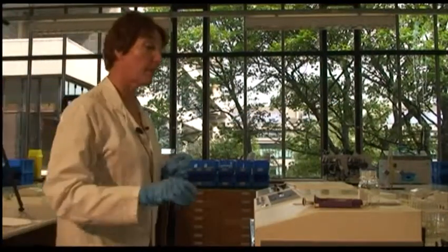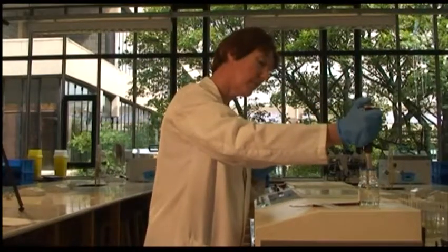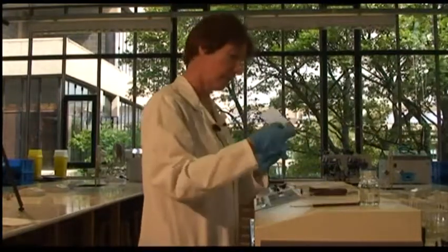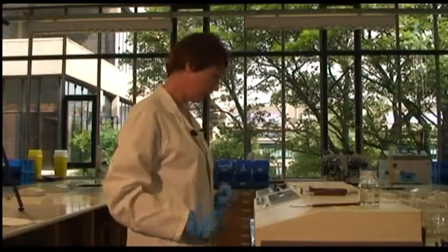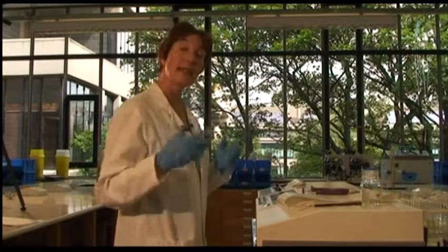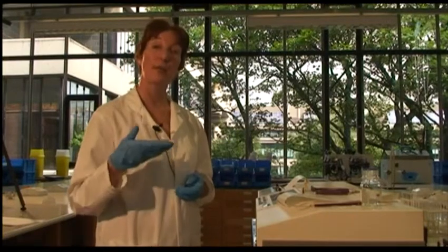If I repeat this experiment with less substrate, so here I've made up a cuvette which contains a much smaller amount of pyruvate, okay, I'll stop that now. If I'd let it run on for a considerably longer period of time, you would have seen that, like the first reaction, this one also would have slowed down and reached equilibrium.